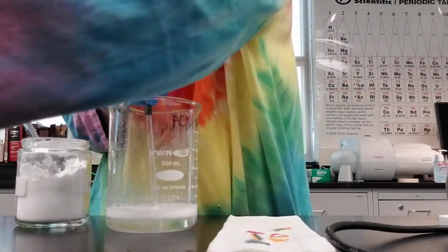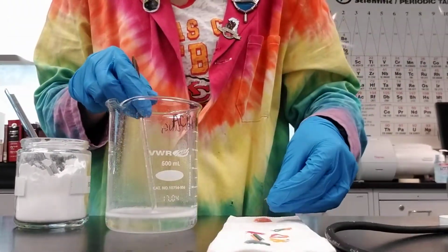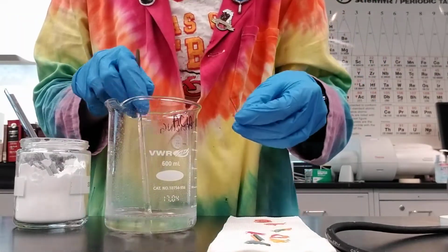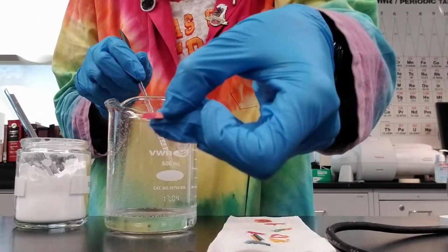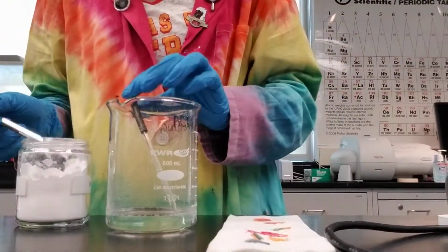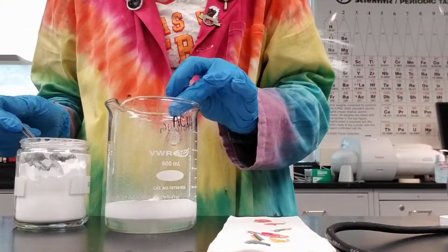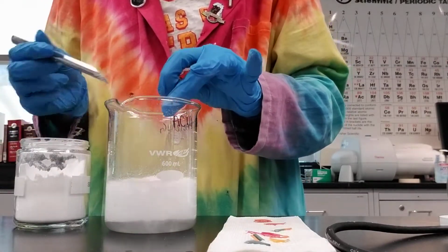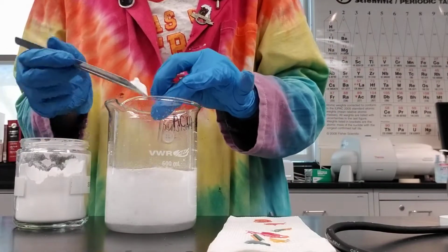All right, I'm going to get a strip of pH paper. Oop, I got that dirty. And test the pH value, and it's still acidic. It's still very red, which when I compare that, it's acidic. So I'm going to add a bunch of baking soda here. It's still definitely bubbling. You can see it's getting pretty high.